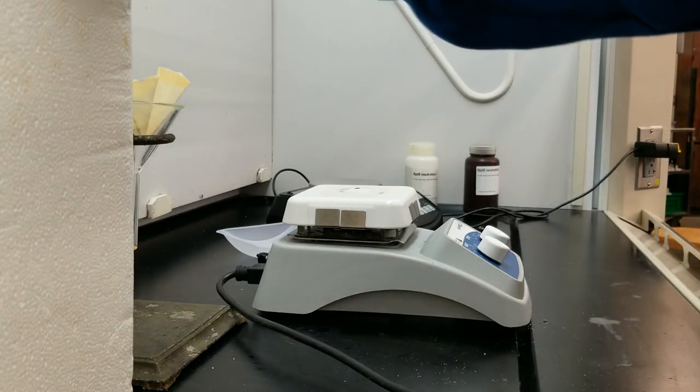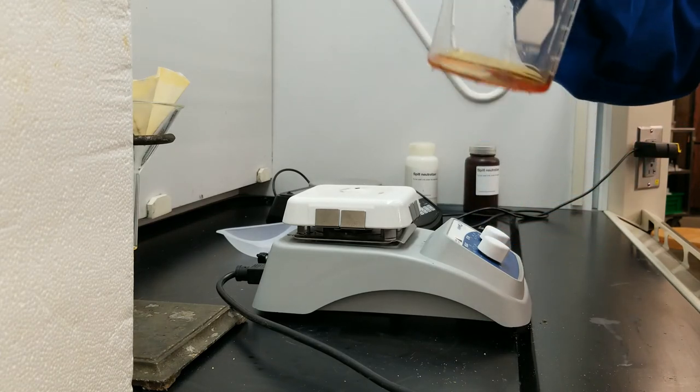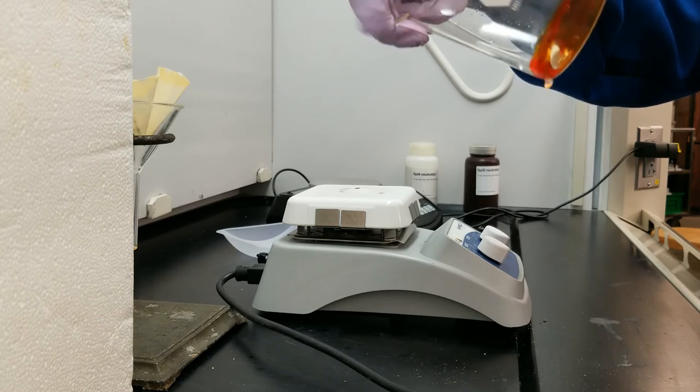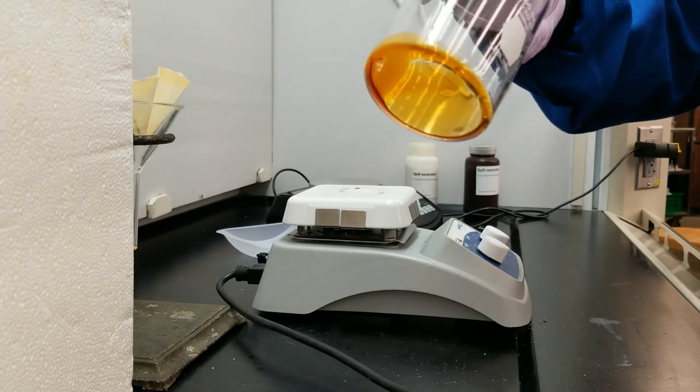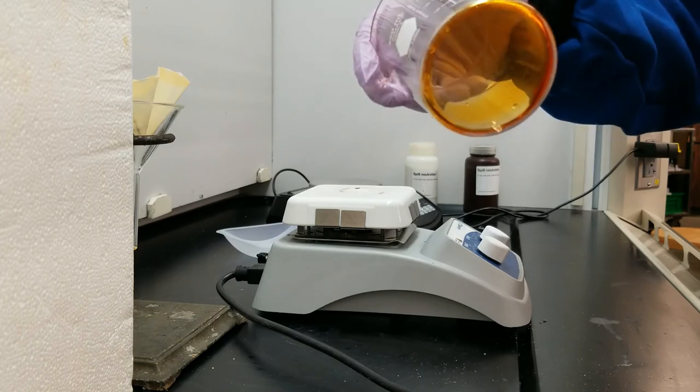It's been a couple of minutes. I'm going to check on my fats that were left on ice. They are still pretty liquidy. And this makes sense because if I refer to the nutrition panel on the bag of chips, I can see that most of the fats, of the 8 grams of fat included in the bag, that 6 of them, 6 grams are monounsaturated fats.